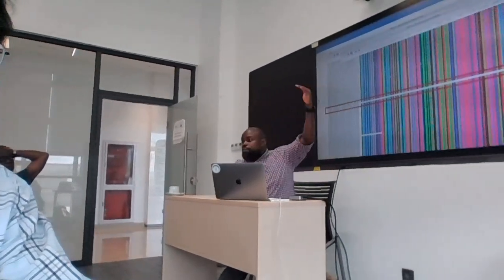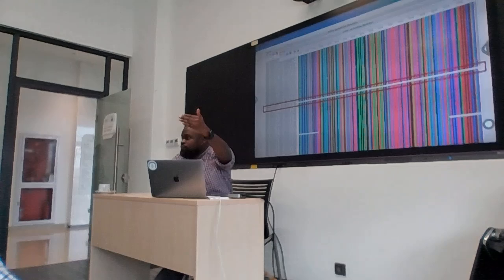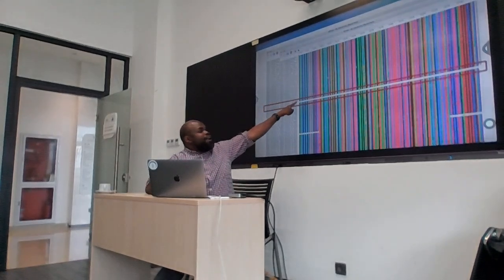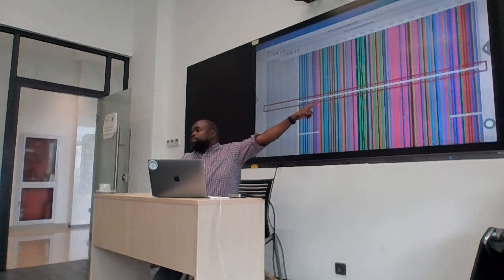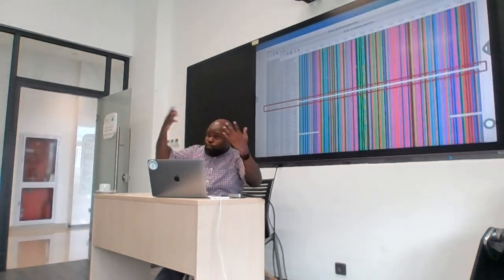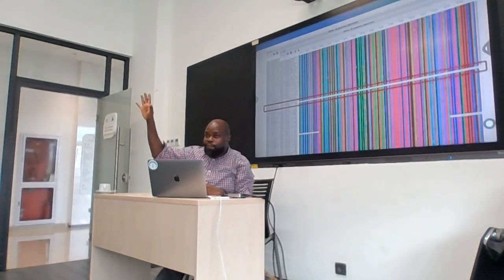Here I'm just showing you a couple of slides that sometimes you want to examine your alignment, right? For example, here we have a sequence that has very many gaps. You might want to remove it, but you might also want to retain it. I say it depends, okay?